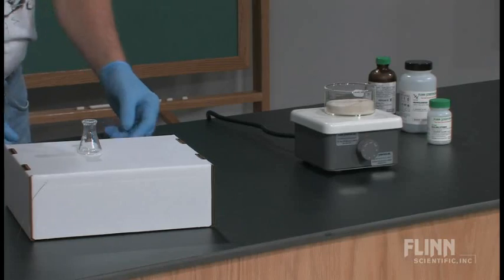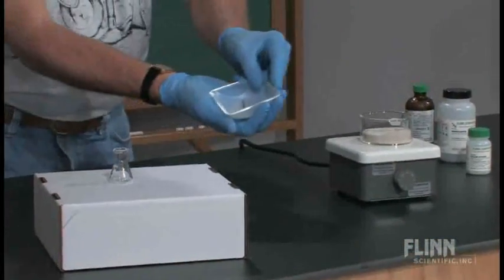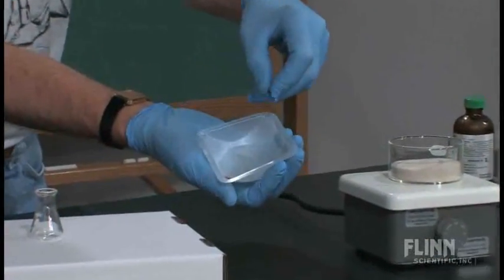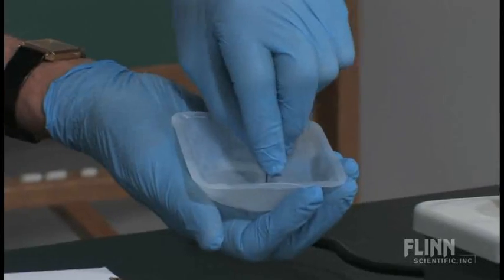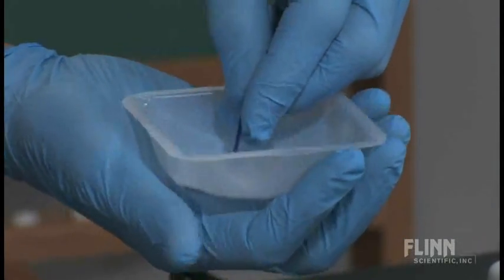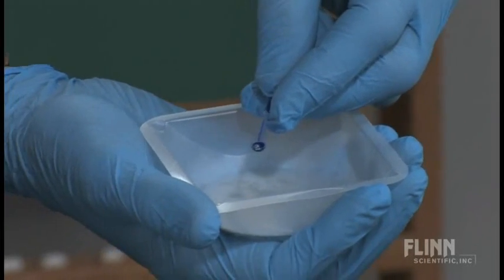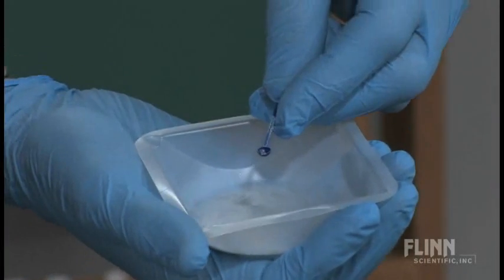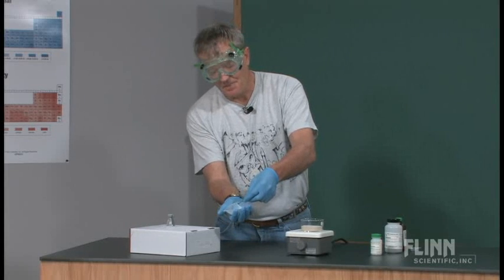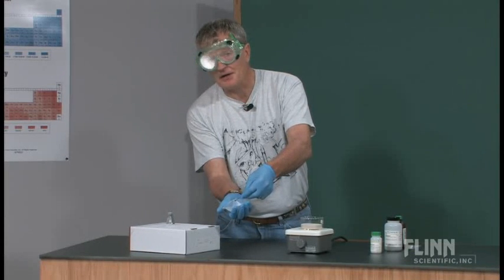And that includes heating a precipitate to dryness, which is pretty hard to do generally in a laboratory situation. So take a look at the lab. This is a small scale lab. We're using small quantities. I have inside this weighing boat some manganese metal that I have ground up by hitting it with a hammer a few times, or a physical change facilitator for those of you that are a little bit, you know, if you've been to a graduate course or two.